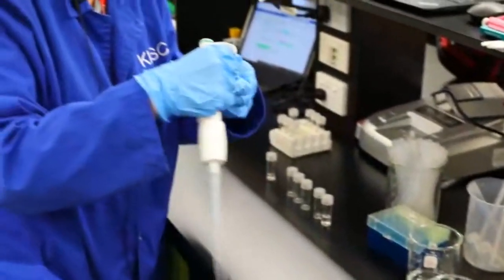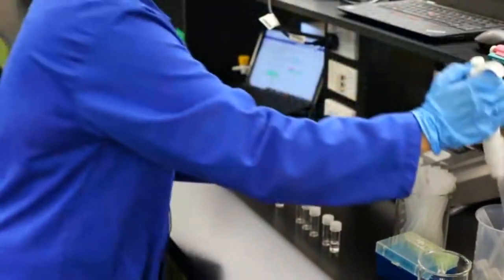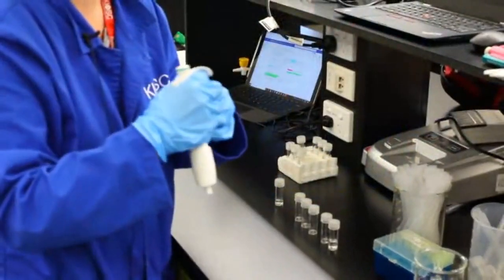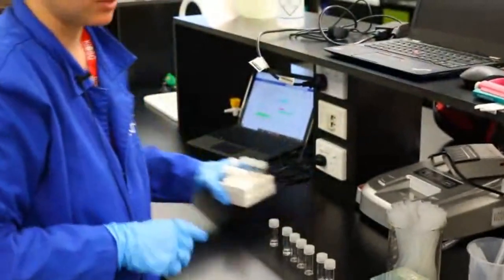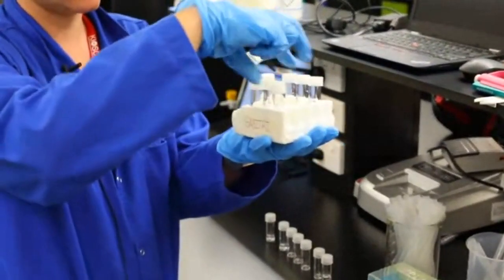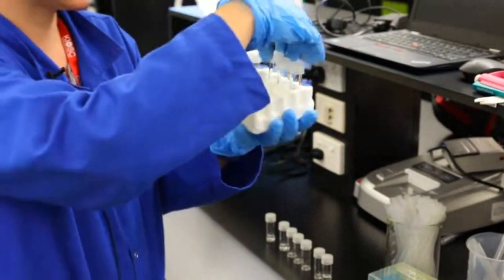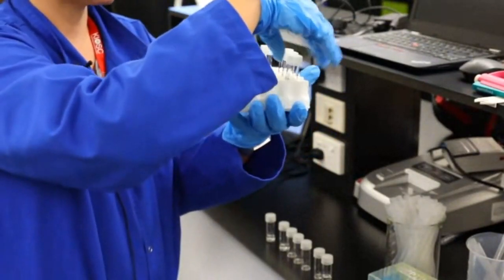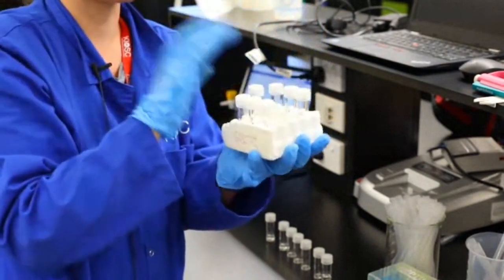And it's going to be a bit of a here's one I prepared earlier, because we have all our samples already made for you, because otherwise you'll be bored sitting there listening to me go through and do all of them. So here's all the ones that we prepared earlier. We have our 0, our 3 milligrams per litre, 6, 9, 12, 15. And then we have our unknown sample that we've got from our lake.